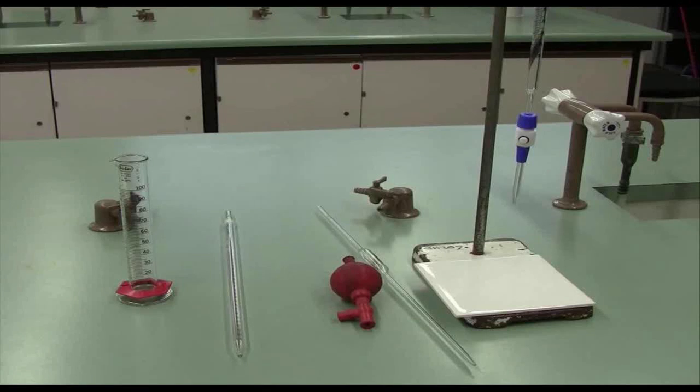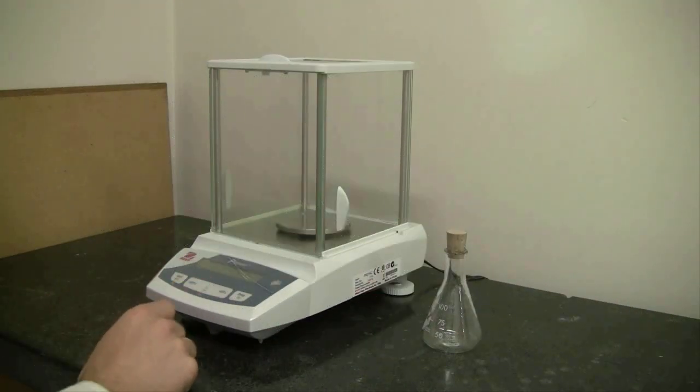Today's experiment is all about learning how to use common chemistry laboratory equipment. You're going to be using a measuring cylinder, a graduated pipette, a bulb pipette and a burette today, and you're going to be using them to deliver 20 mls of water as accurately and precisely as possible.